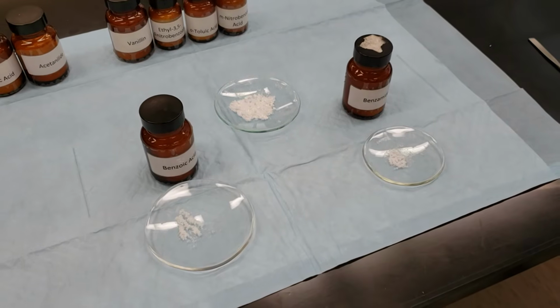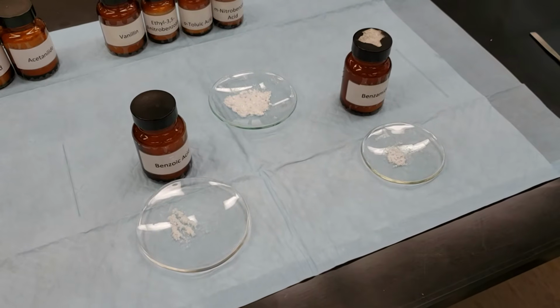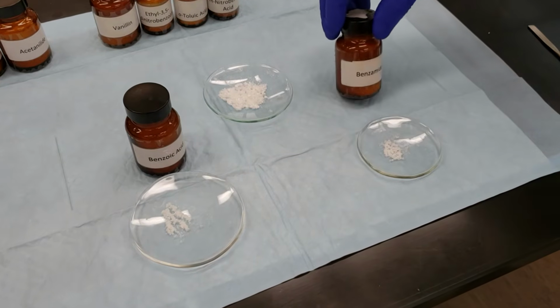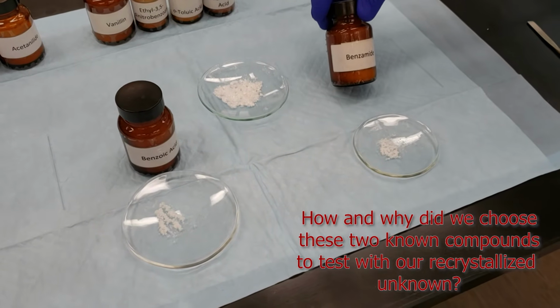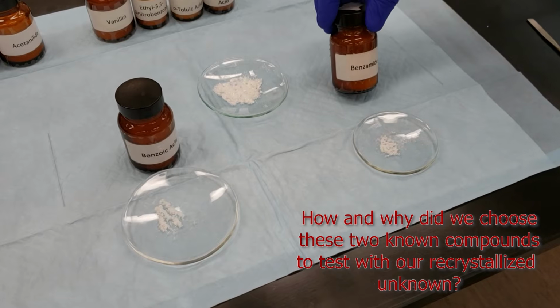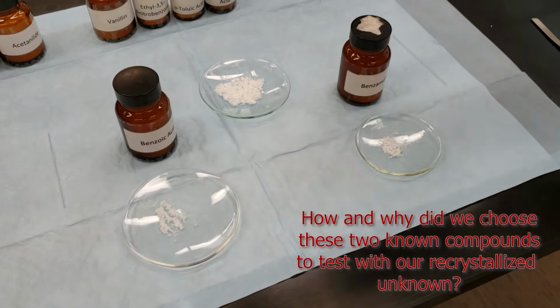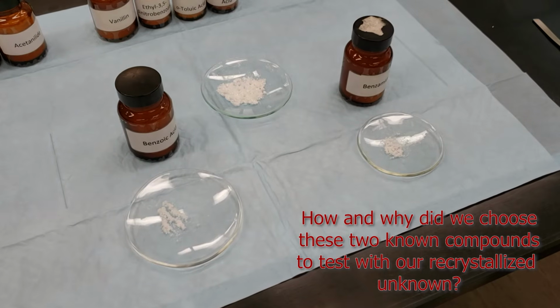All right, now that we have both our fast and slow initial melting points for our unknown, we've come up with two candidates that are close in terms of their melting point ranges. We've got benzamide on the right-hand side, and we have benzoic acid. We have to do what's called a mixed melting point determination.